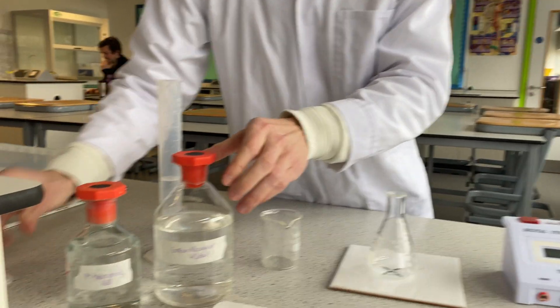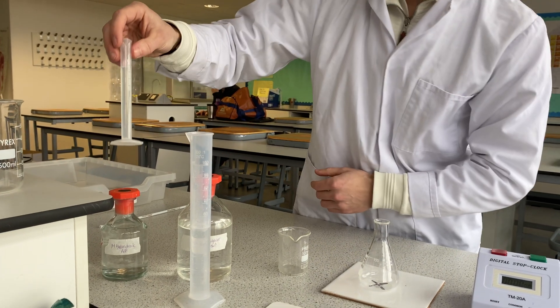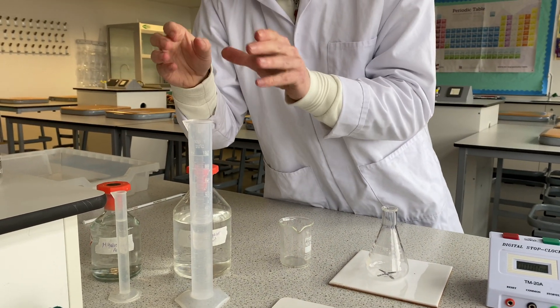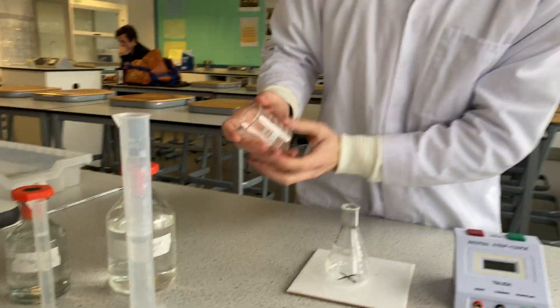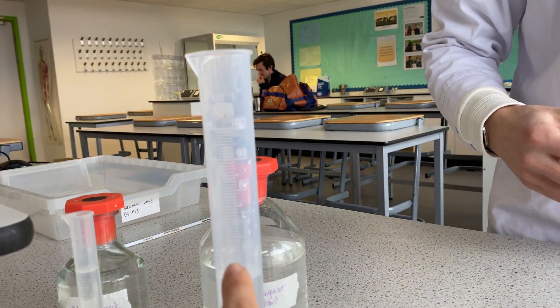We've already pre-measured our reactants. I've got 50 cm³ of sodium thiosulfate in a measuring cylinder, and 10 cm³ of hydrochloric acid in another. The larger cylinder is used for the larger volume for accuracy. We're using measuring cylinders rather than beakers because beakers are not very accurate — measuring cylinders have more graduations and are therefore more accurate.